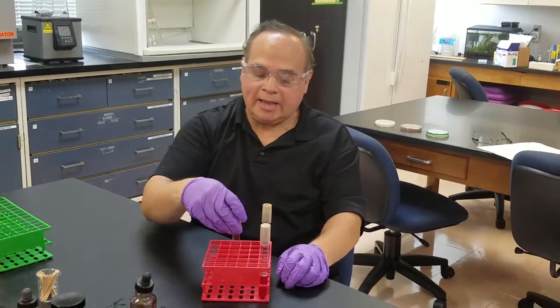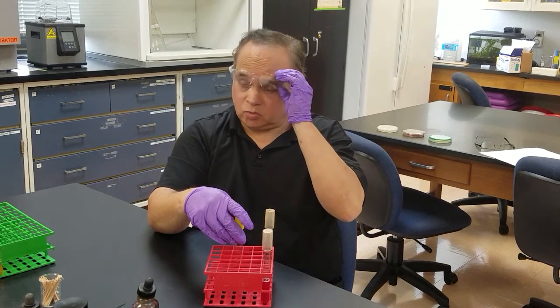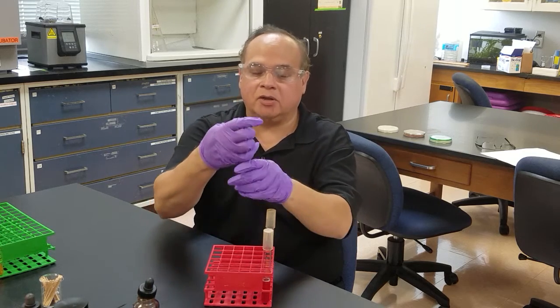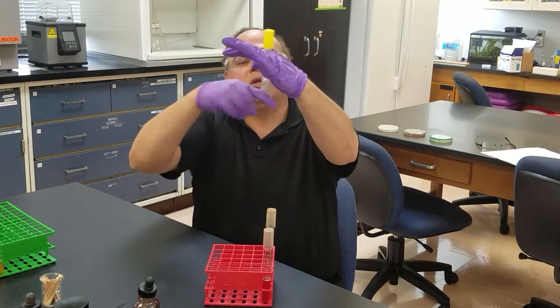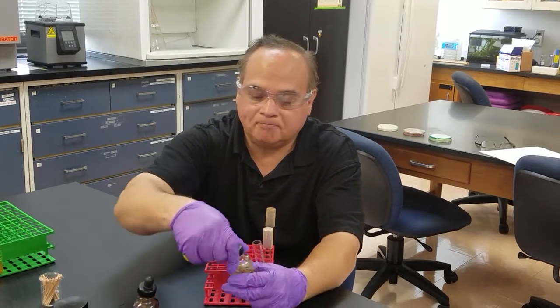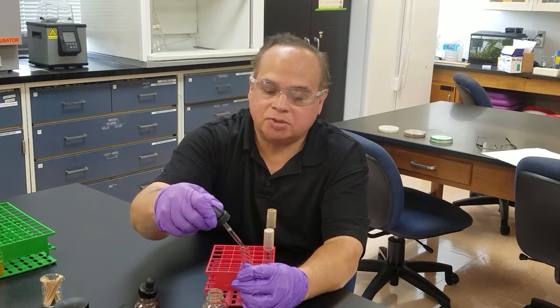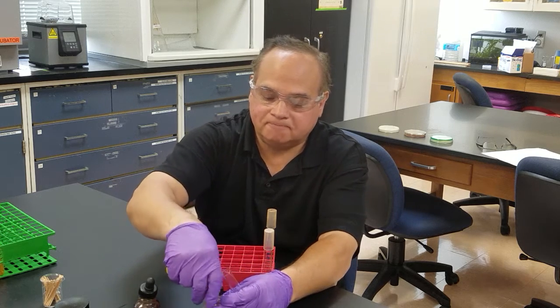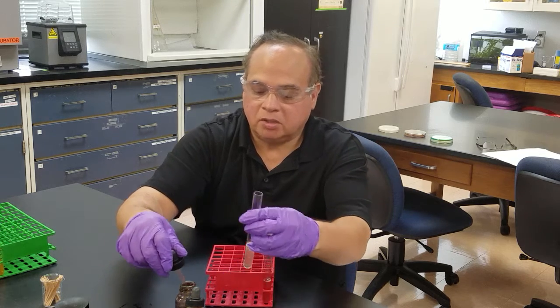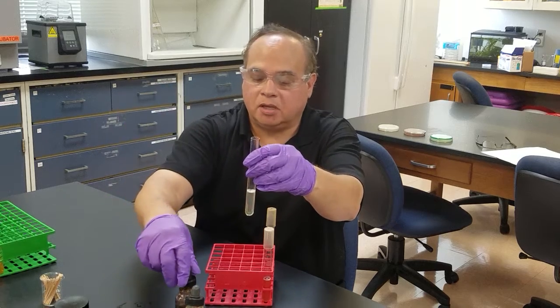Now I'm going to show you a negative test using Enterococcus faecalis. I'll mix it up, add about five drops of sulfanilic acid and five drops of naphthylamine — and nothing happens. So at this point one of two things has occurred and we need to figure out which.